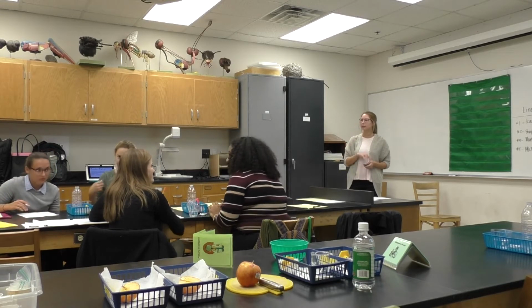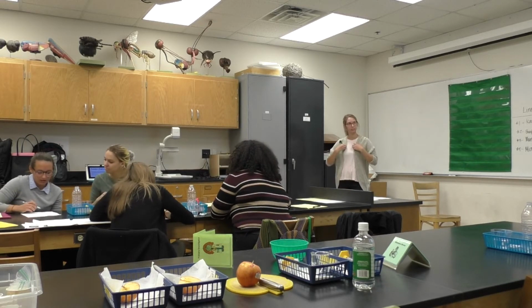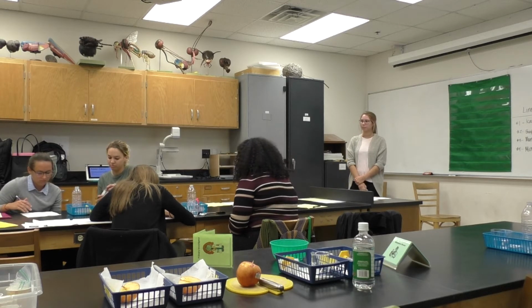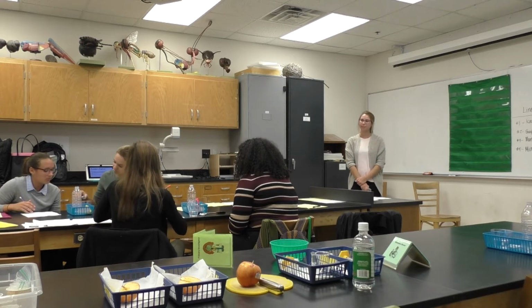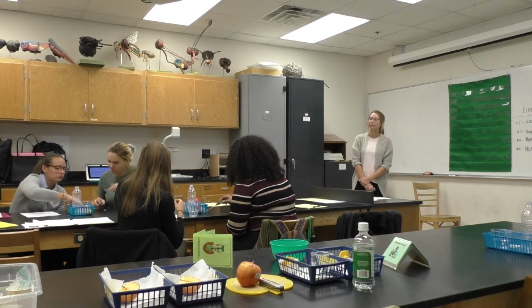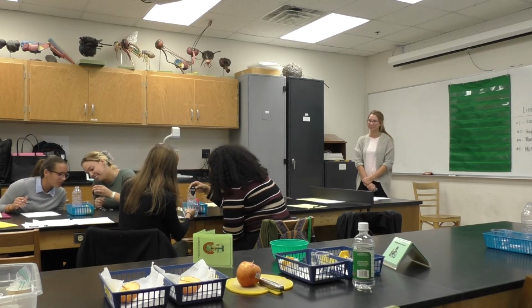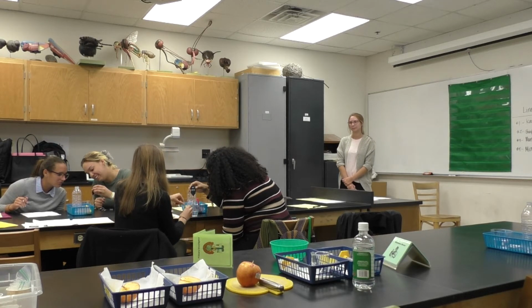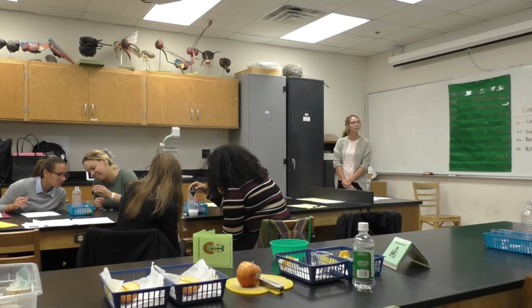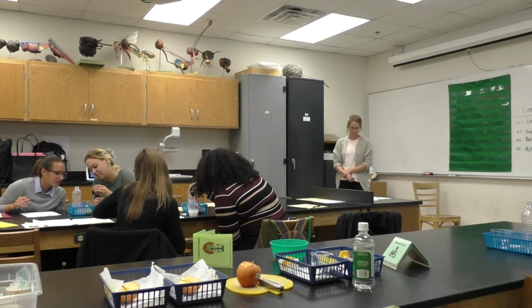Right, thank you, Anna. If you guys could answer the question about your predictions of what will occur when you add the antacid. So remember, you're going to want to record the temperature, so keep the thermometer in the water. Look at that. Oh, it's dropping. Okay. It is bubbling. Yeah, it's had a temperature decrease.